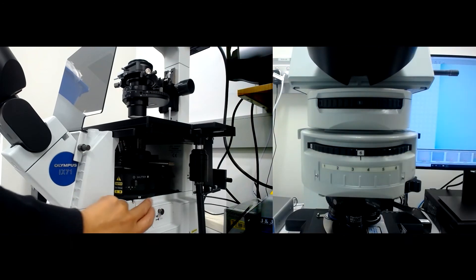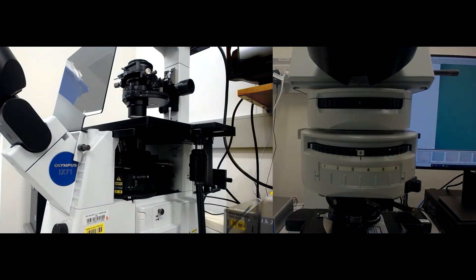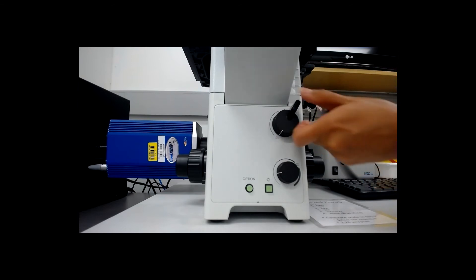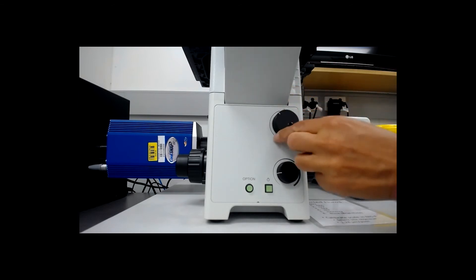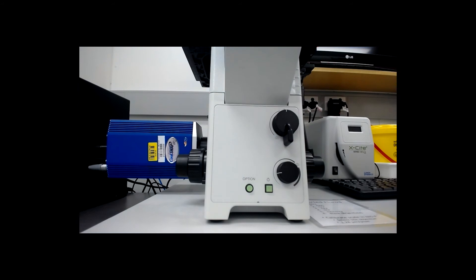Check the emission turret is in the brightfield or no filter position. Make sure the light is directed to the eyepieces by turning the knob on the inverted microscope.